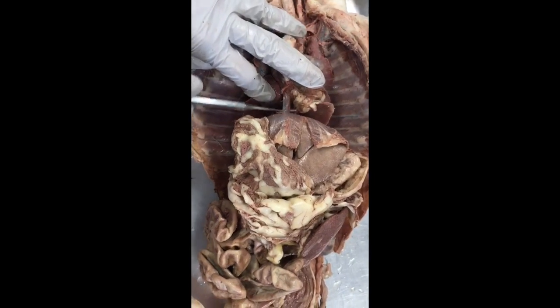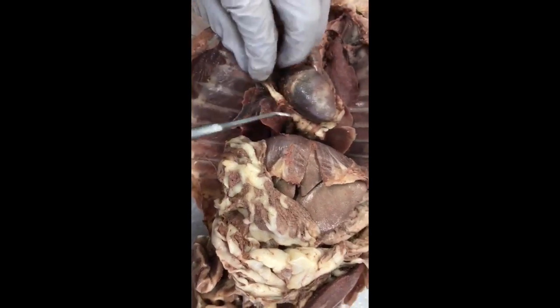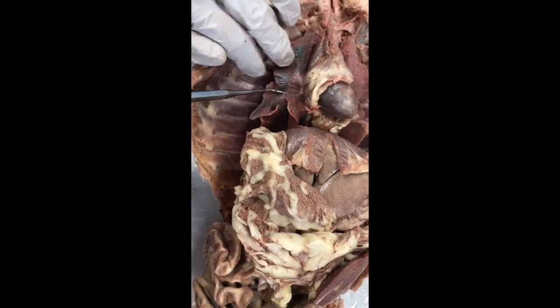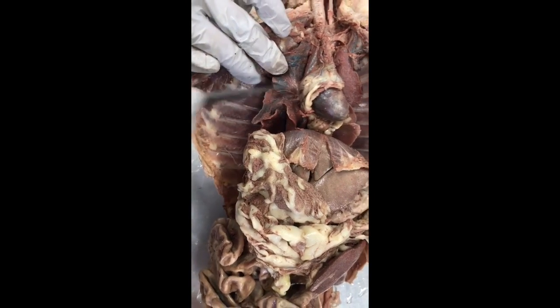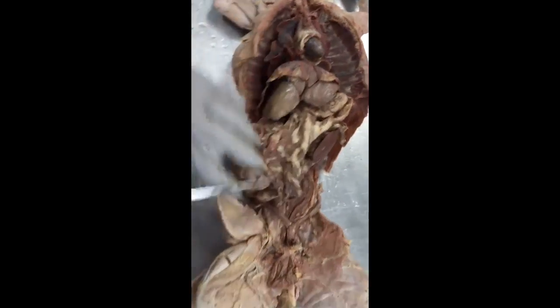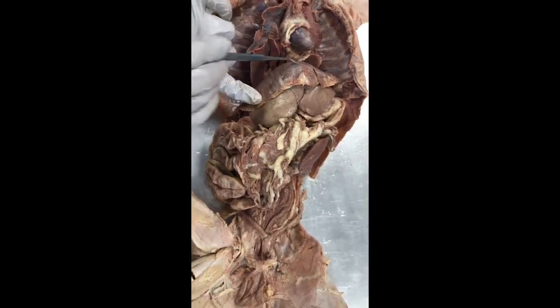And then the pulmonary veins and arteries can't really be seen, but the veins would be going into the heart and the arteries would be coming away from the heart. Then we have the diaphragm, which is this muscle right here.